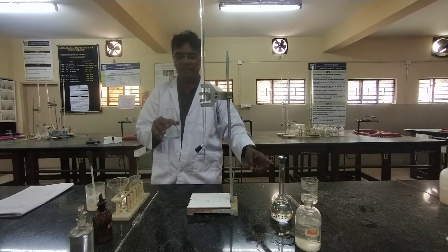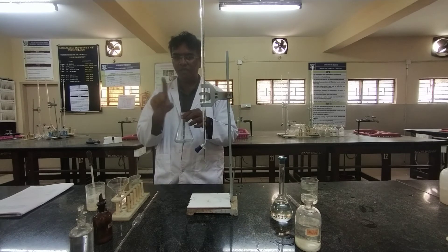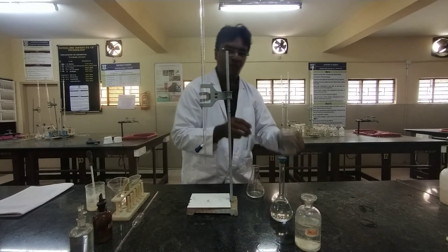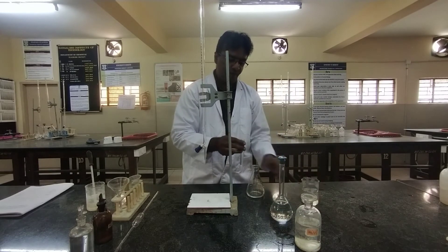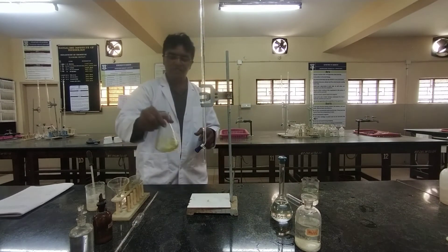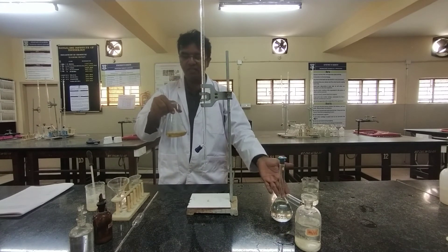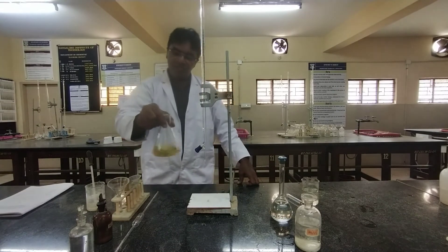Now add one test tube of potassium iodide to the solution. The copper ions present will oxidize potassium iodide into iodine, which you can observe by the formation of a yellowish color. Iodine is a dark brown compound, but because the brass solution is diluted here, you get a dark yellowish color — indicating liberation of iodine.